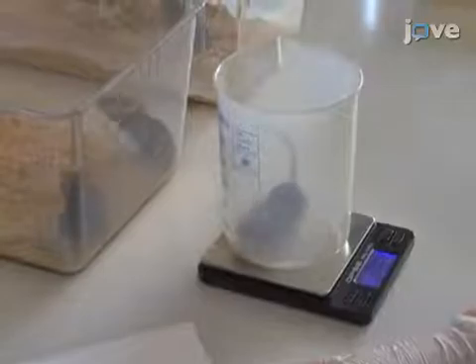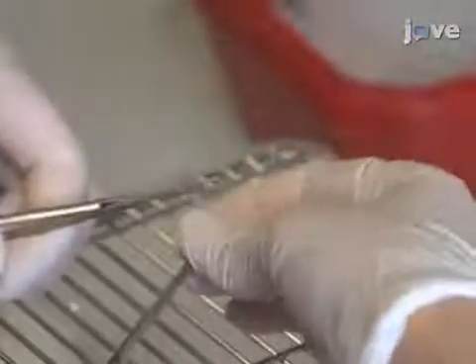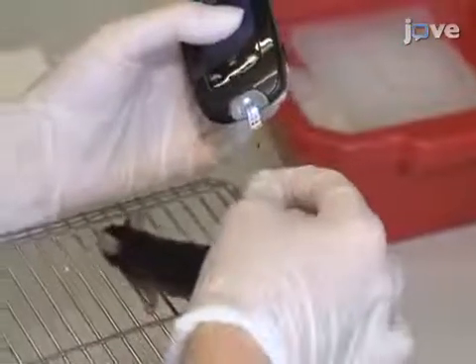Next, measure the body weight of all mice and mark their tails with a permanent marker to make the mice easily distinguishable. To collect blood for baseline sampling, use sharp scissors to carefully cut off 1-2 mm of the tail tip. Wipe off the first drop of blood to avoid hemolysis or contamination with tissue fluid before taking new blood samples for blood glucose determination. Draw a small blood sample for the measurement of the basal blood glucose level with the glucometer, then collect a larger blood sample.